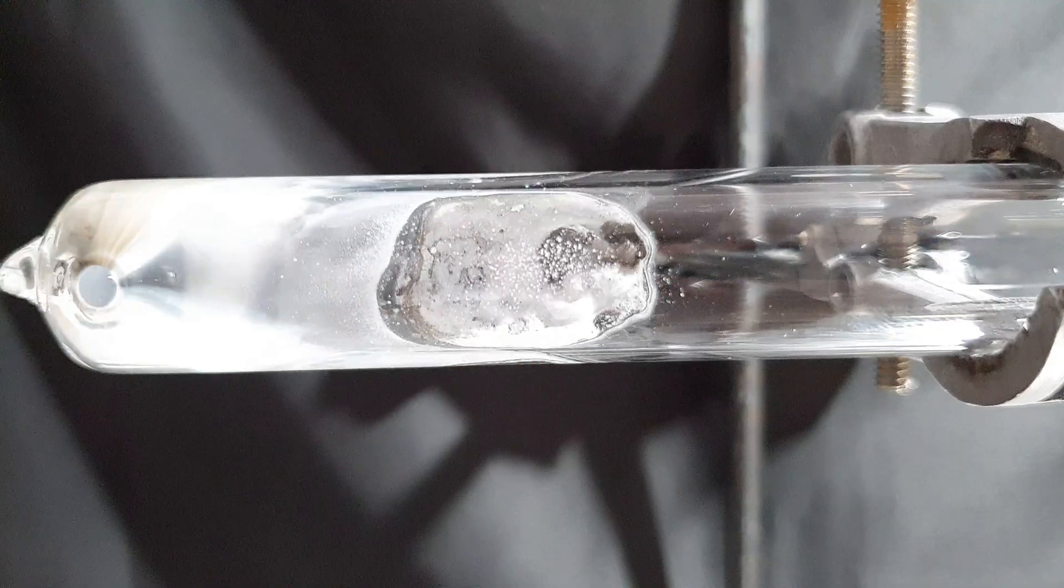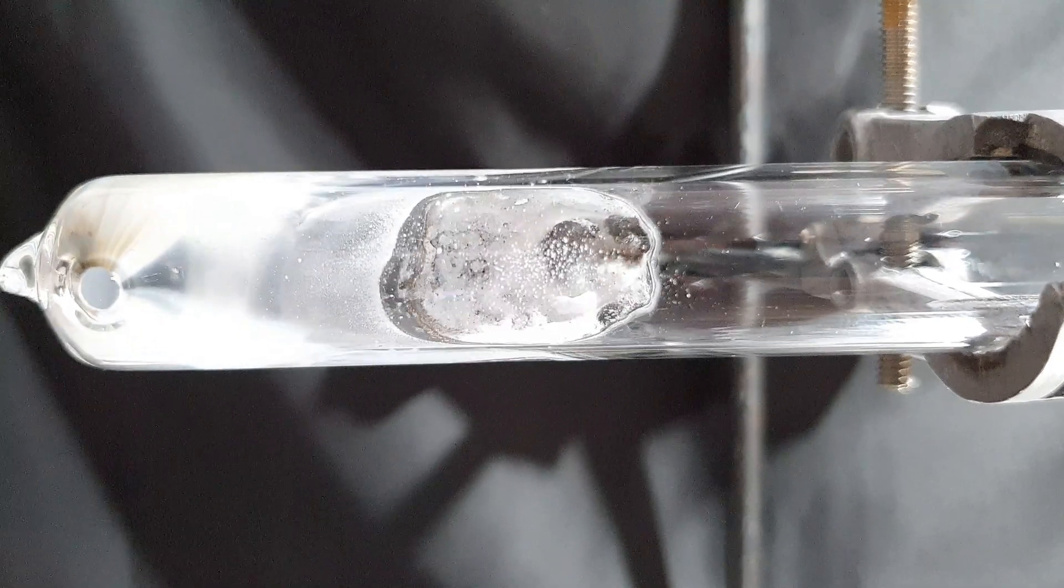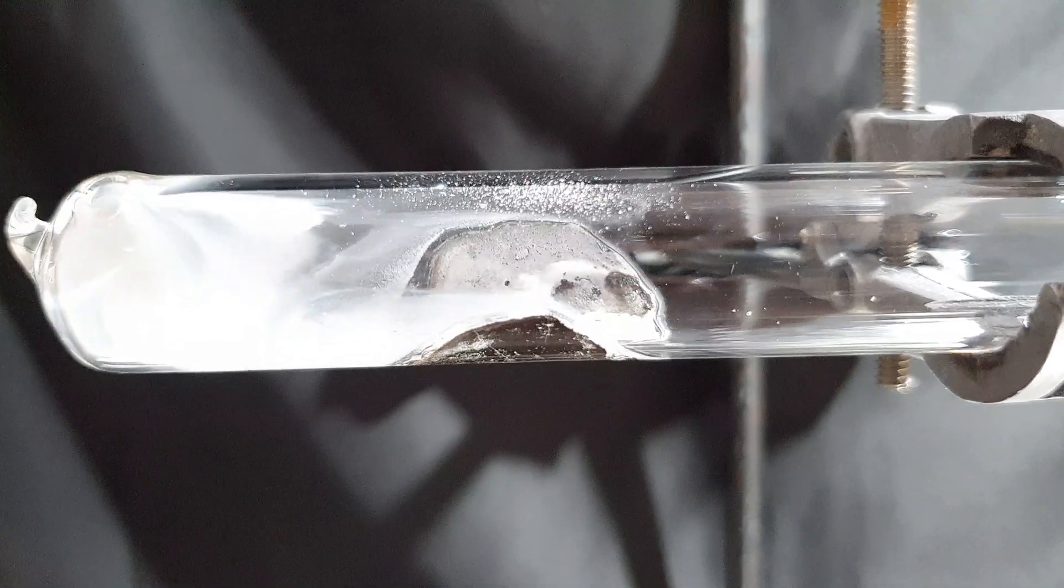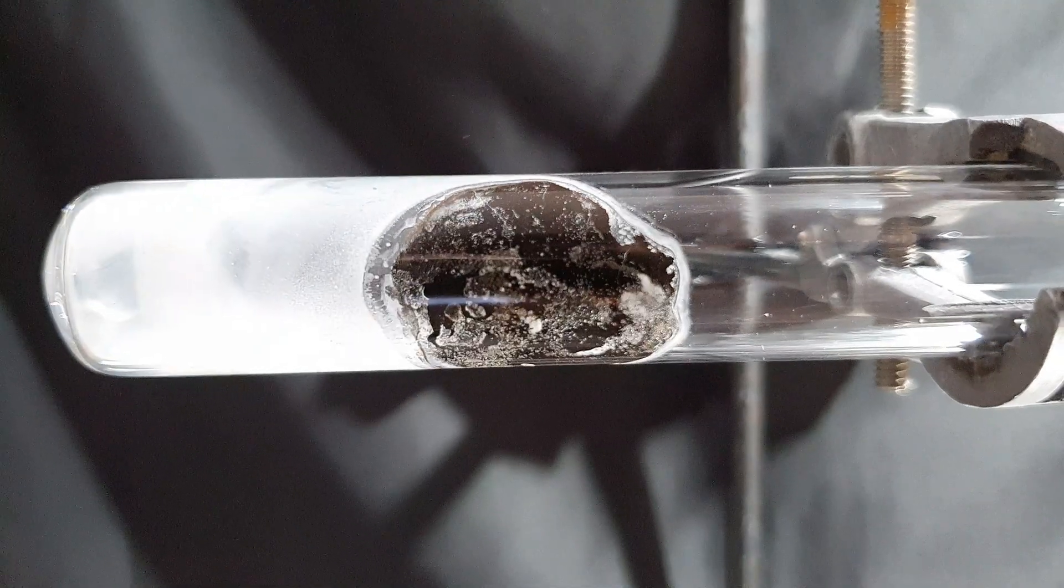After the reaction you can see that mostly lithium oxide has formed, a white solid. A small portion of the lithium has also reacted with the surface of the glass in this case.